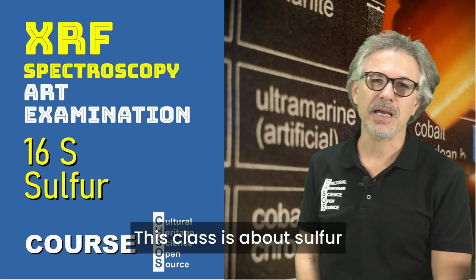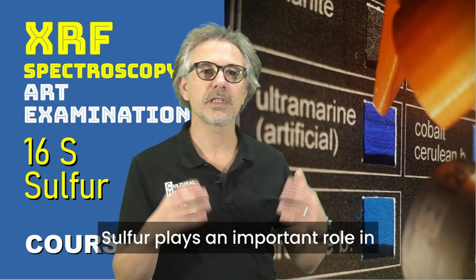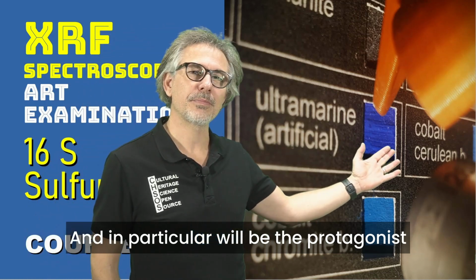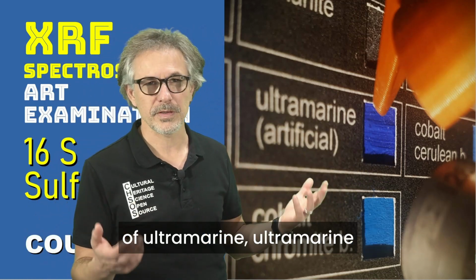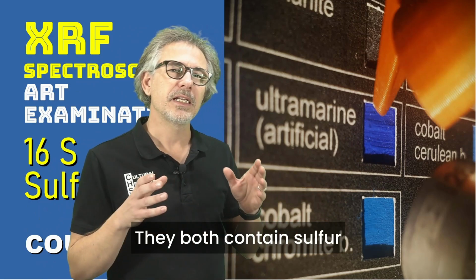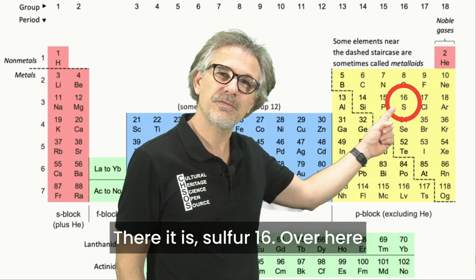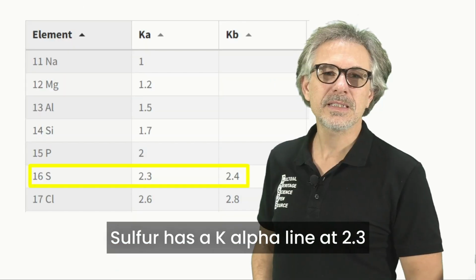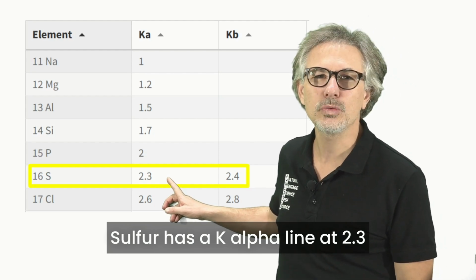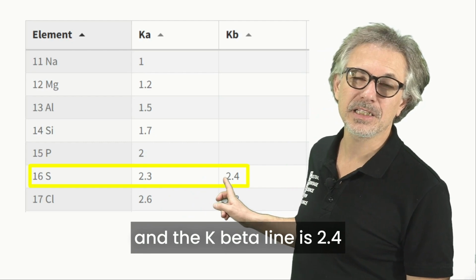This class is about sulfur. Sulfur plays an important role in pigments examination, and in particular will be the protagonist of ultramarine. Ultramarine, natural and artificial, both contain sulfur. There it is, sulfur, 16, over here. Sulfur has a K-alpha line at 2.3 and the K-beta line is 2.4.